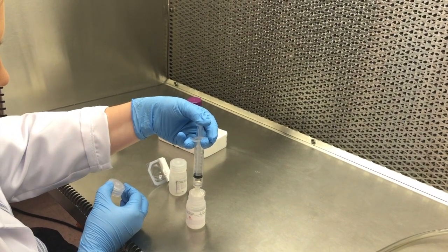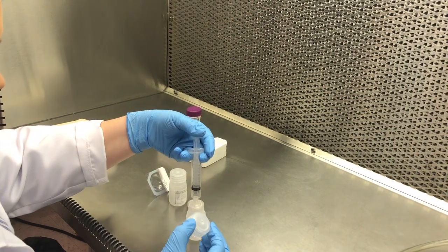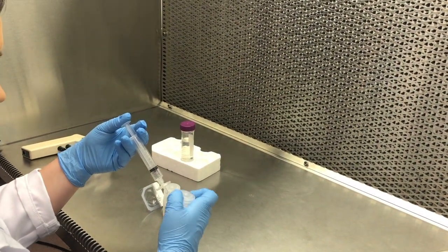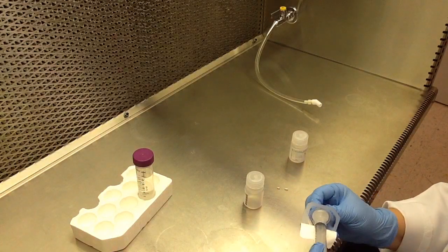Once all of the solution has been filtered, close up the top of the solution bottle. You can go ahead and discard the filter and the syringe.